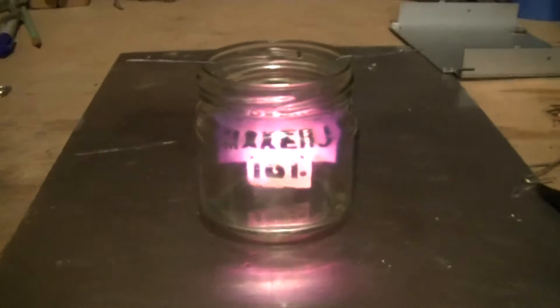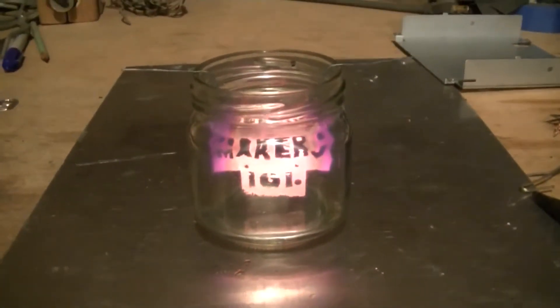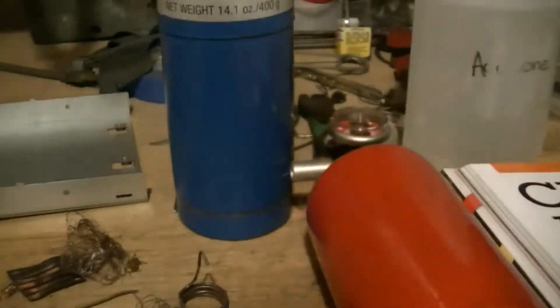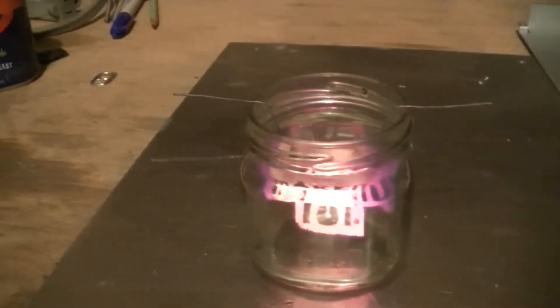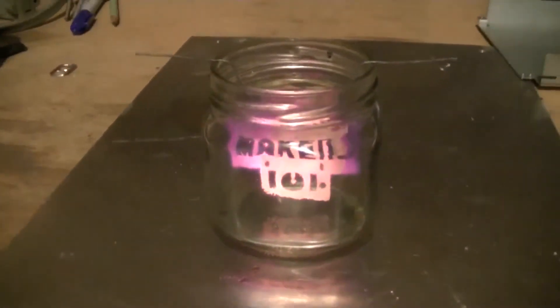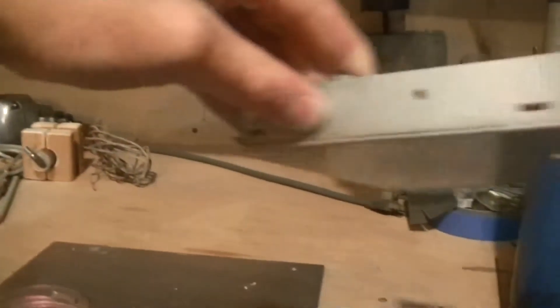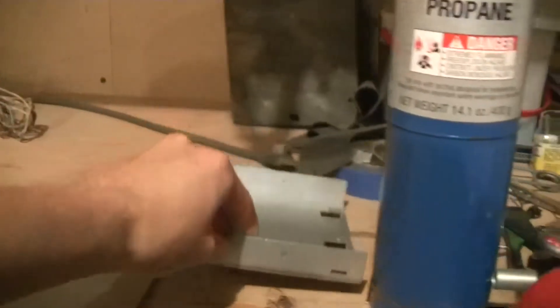If you're planning on possibly trying to replicate this experiment, make sure you wear safety goggles and have a fire extinguisher handy because acetone is quite flammable. I've had it go up in flames a couple times here, so also have a piece of metal or something to put it out so you don't have to use the fire extinguisher. You just set it on top and it'll go out.